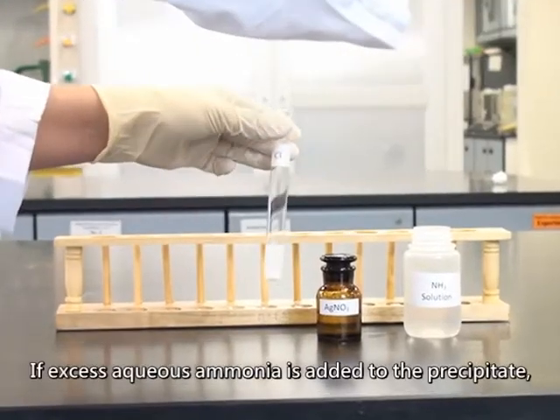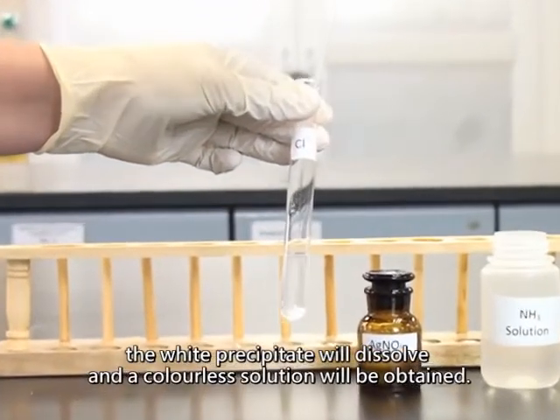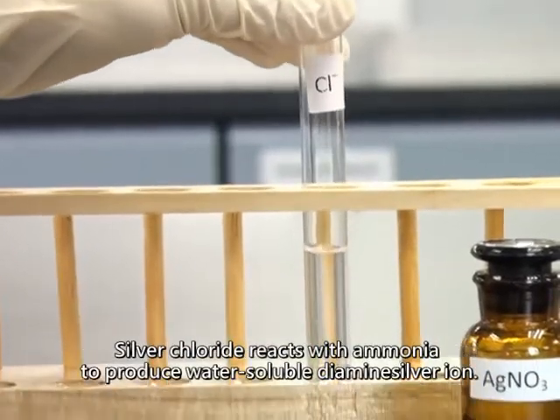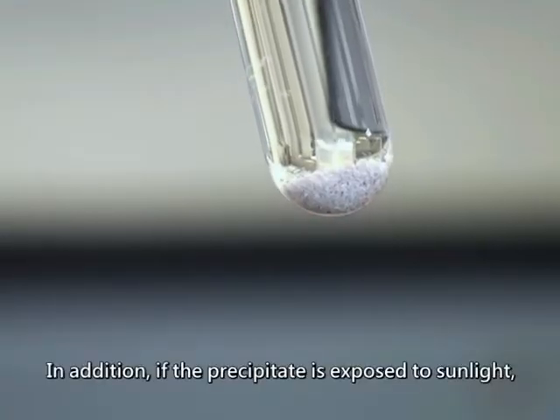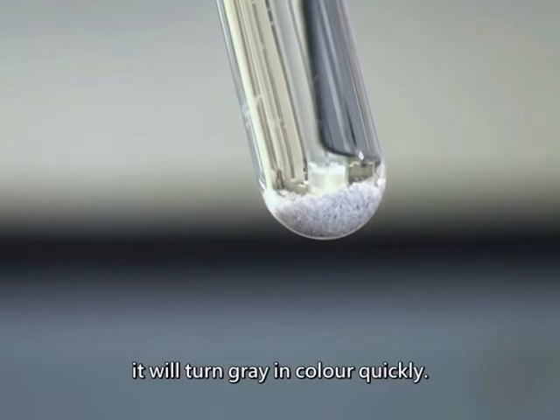If excess aqueous ammonia solution is added to the precipitate, the white precipitate will dissolve, and a colorless solution will be obtained. Silver chloride reacts with ammonia to produce water-soluble diamminesilver ion. In addition, if the precipitate is exposed to sunlight, it will turn gray in color quickly.